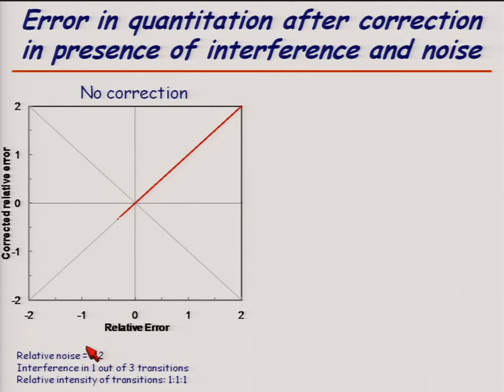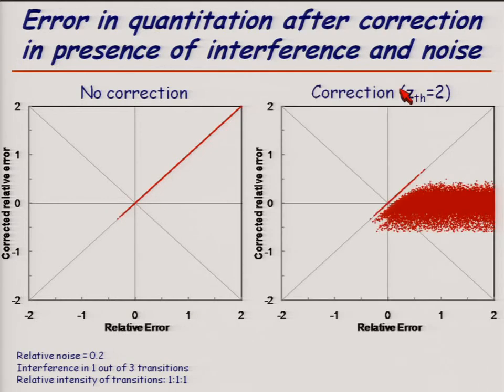So if we look at the same case as before, we have a relative noise of 0.2. We have interference in 1 out of 3 transitions. And again, we have 3 transitions, each with the same relative intensity. So now, if we don't do any correction, all the points will end up on the diagonal. And if we do a correction with a threshold of 2, we see that there are some points left on the diagonal, but for most, we get points around 0, and the width of this depends only on the noise.